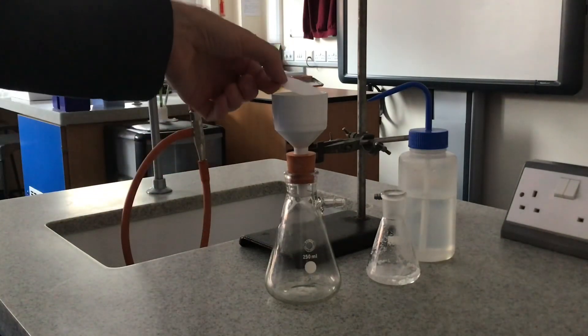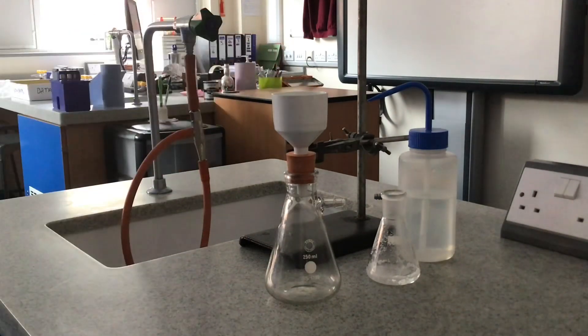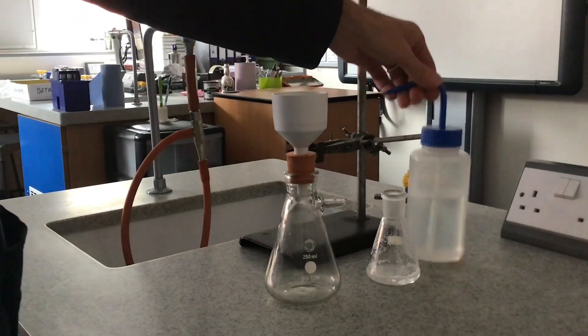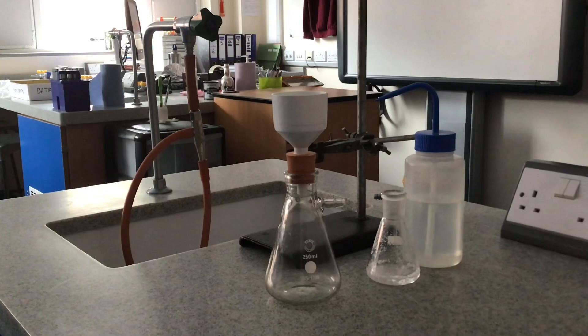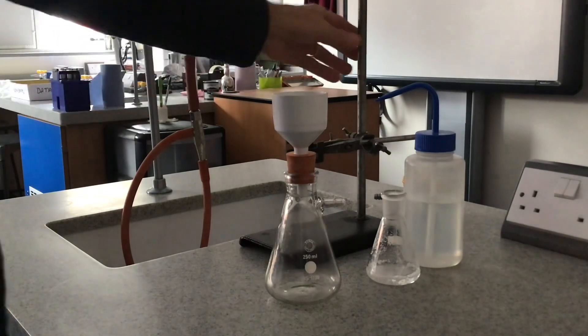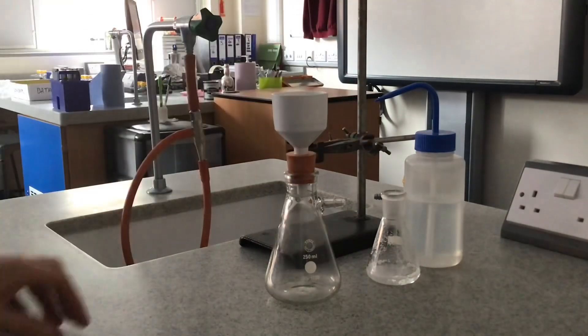Filter paper, so that's going to go in there. We've got some solvent, this is just distilled water for the purpose of the demonstration. We've got a retort stand, a clamp, and a boss head.